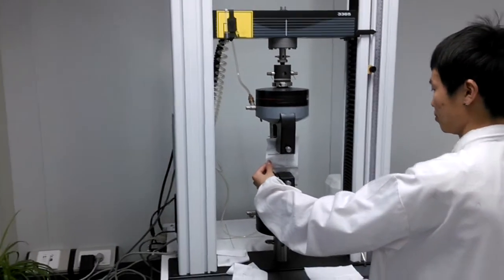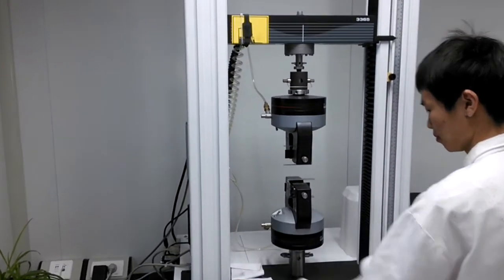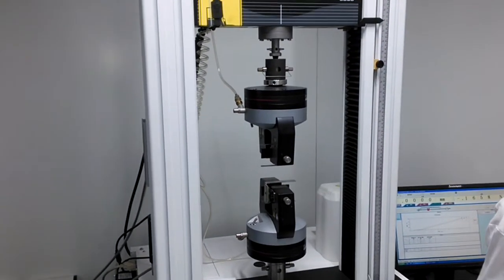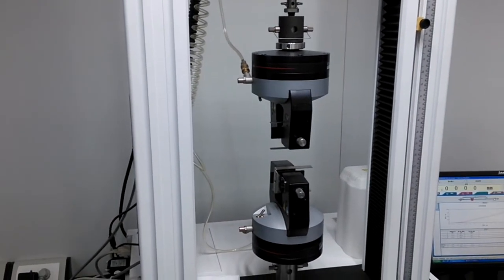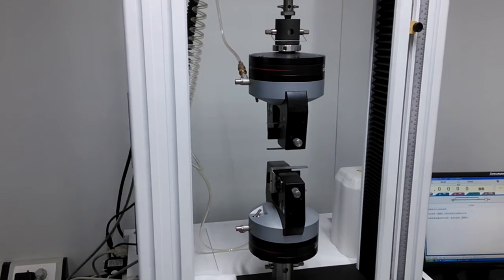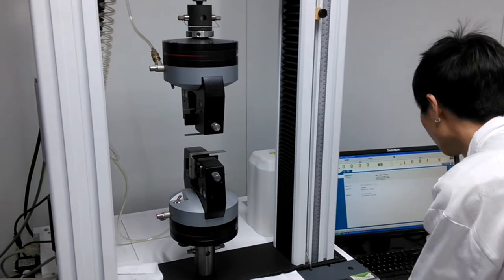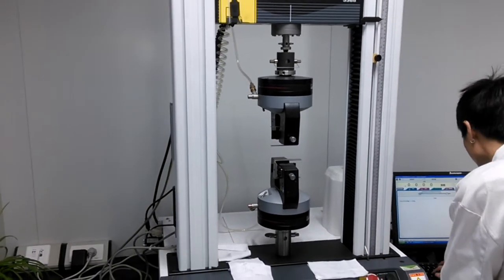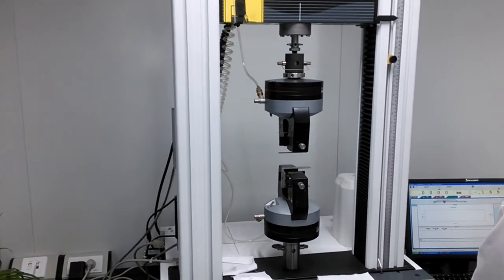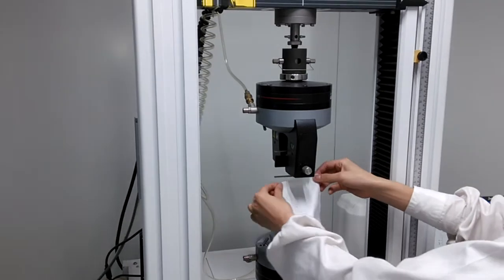This equipment is also used for the ASTM D1683 seam strength test. We can set different requirements via the computer, and the pulling speed will change accordingly, which applies to this other standard.